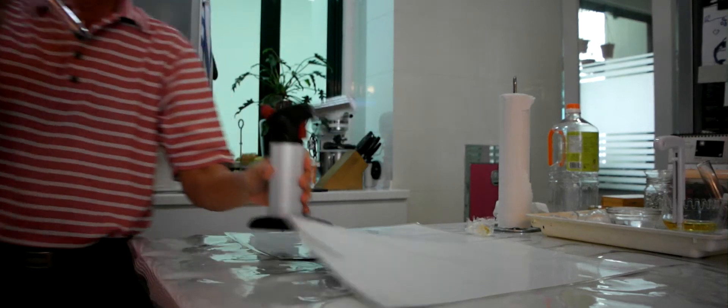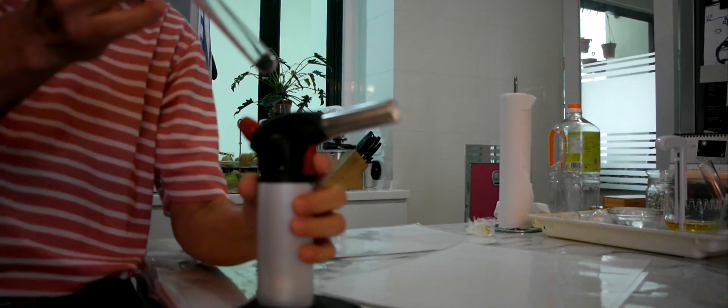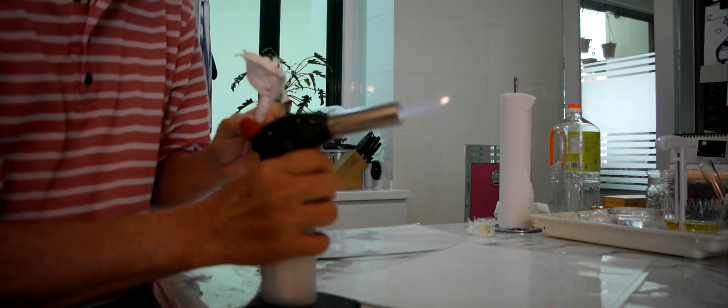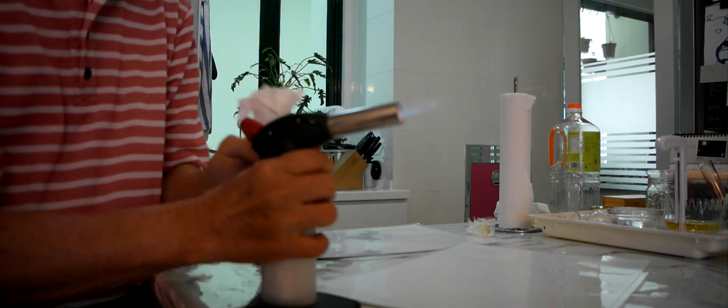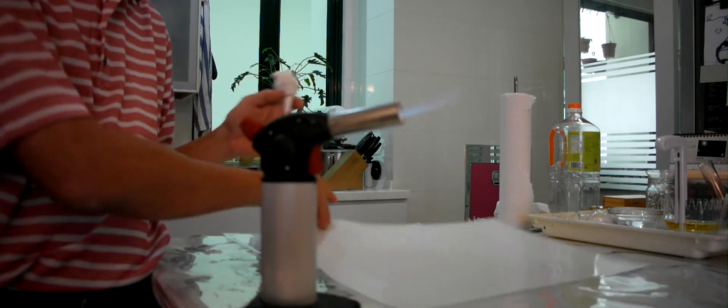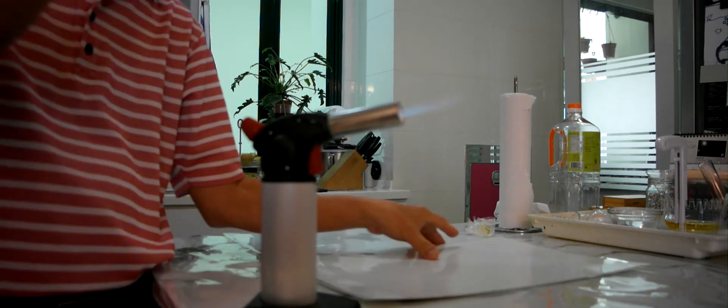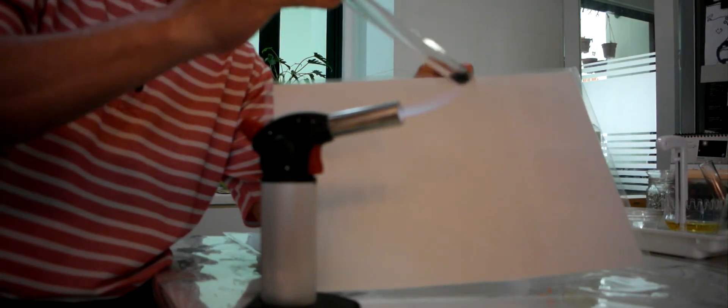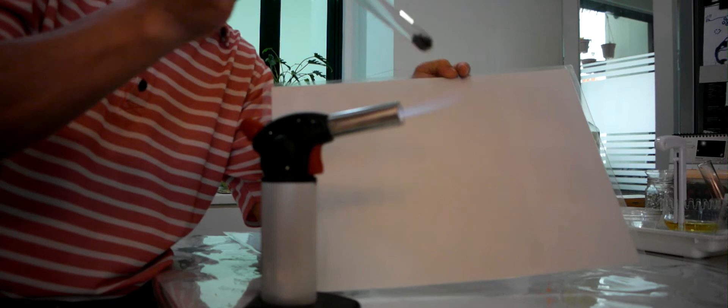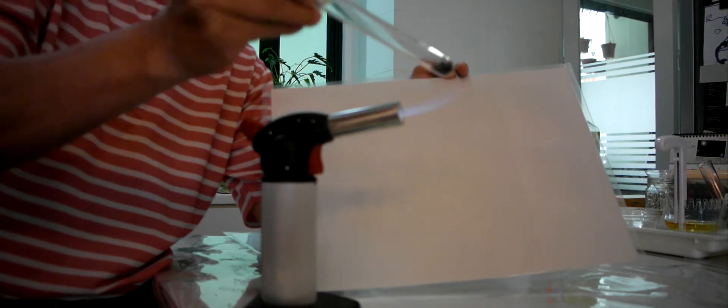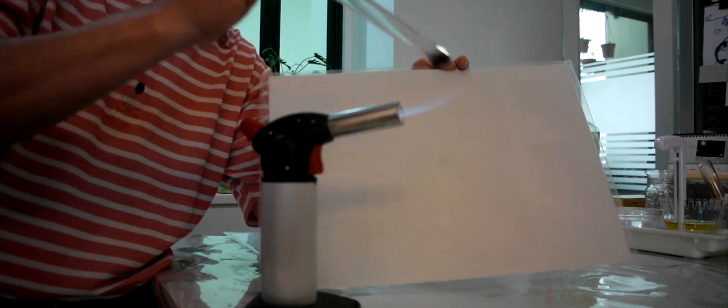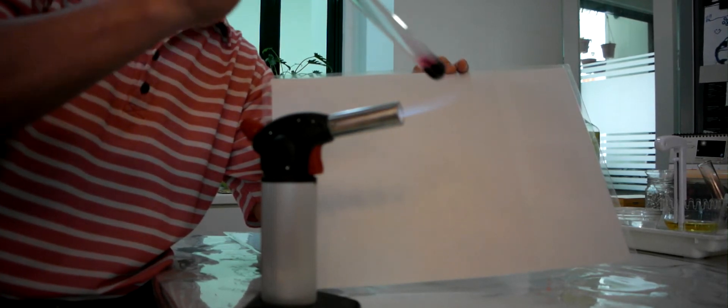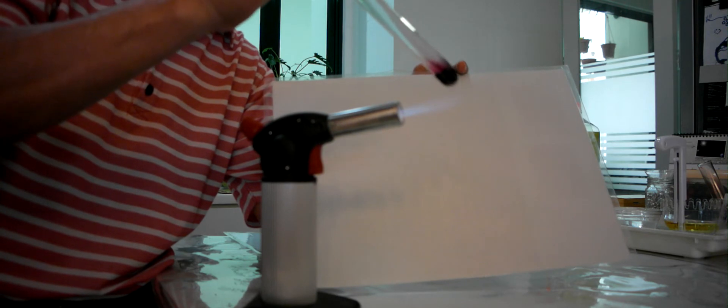So what we are going to do is we are going to heat the iodine gently. You will still get some iodine vapour, but most of the iodine will melt into a liquid.